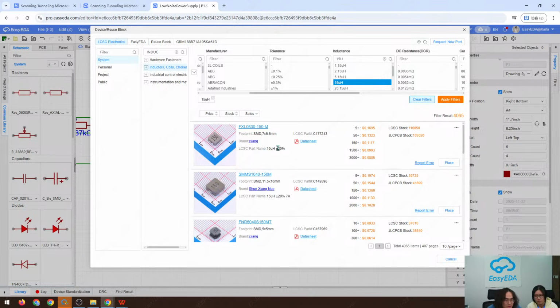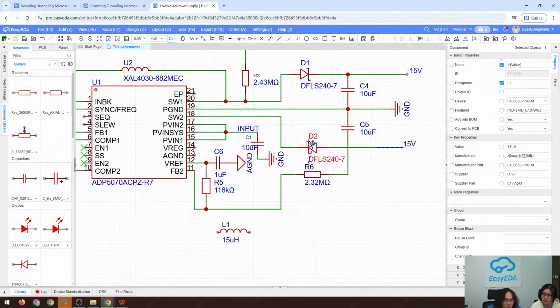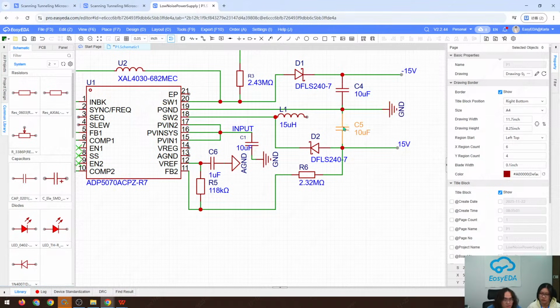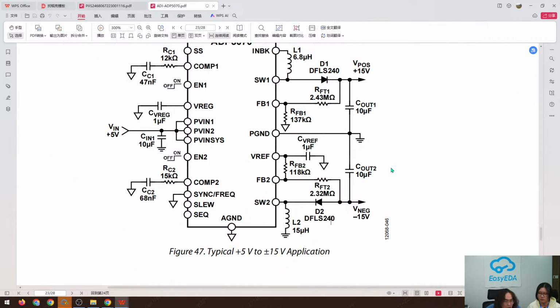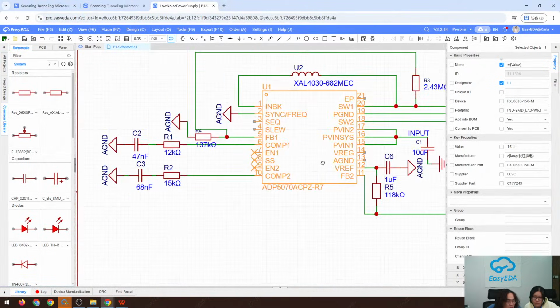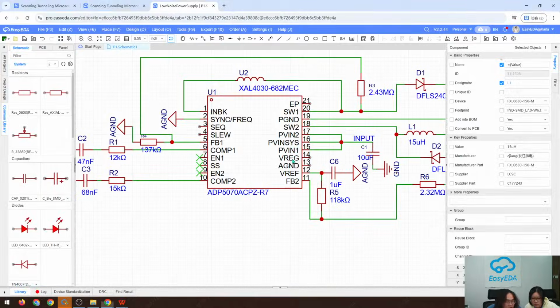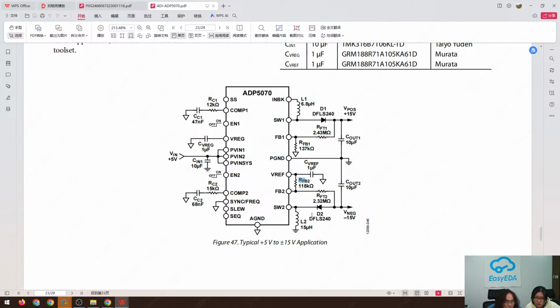Okay, we can place this one to ground. SW2 to ground. SW2 to ground. Oh, this is ground. Anything I missed? Oh, here. VREG. Which pin? VREG. Here. How is it connected? It's connected to the ground. This.